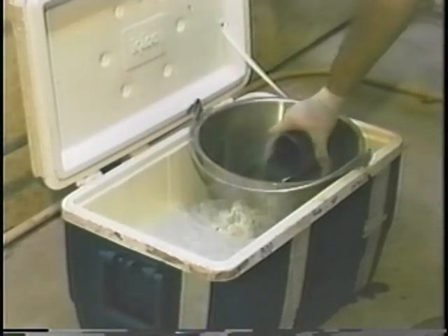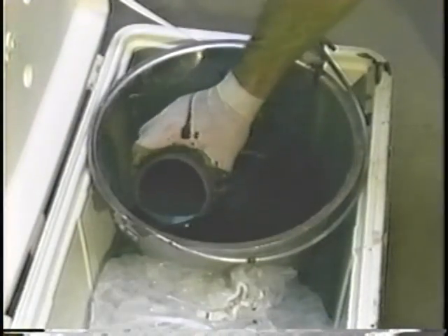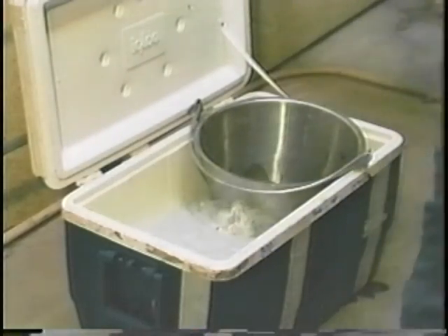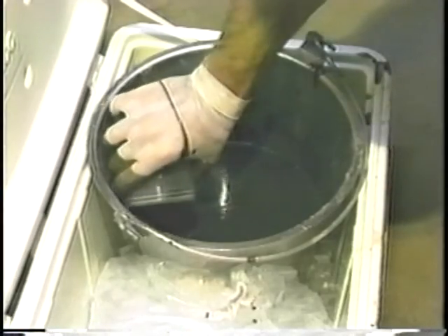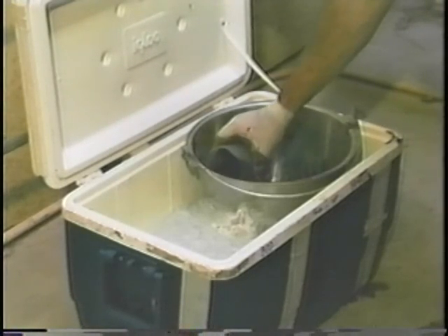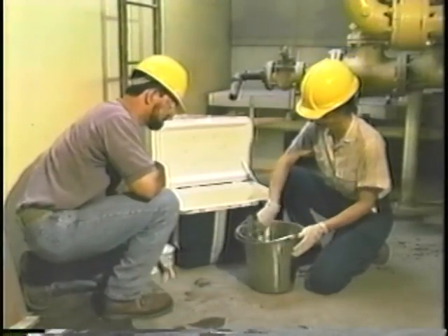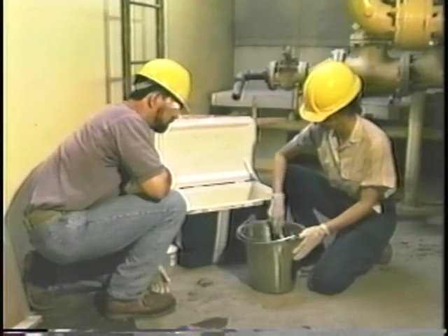To take a composite sample for metals analysis from a digester, collect a series of equal volume grab samples called aliquots periodically throughout the entire time the sludge is being discharged. For example, if the sludge is discharged over a 6-hour period, take 6 aliquots at 1-hour intervals. Pour each portion or aliquot into a clean bucket. The bucket must be kept on ice. When you are finished, thoroughly mix the sludge in the bucket and quickly fill the sample container.